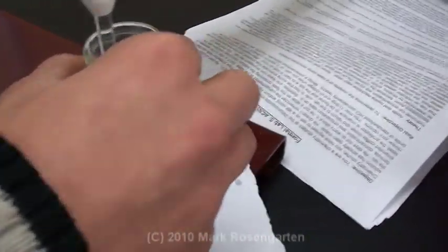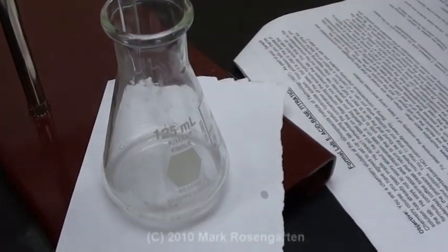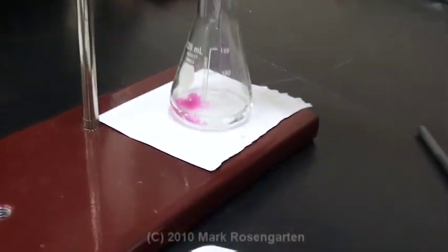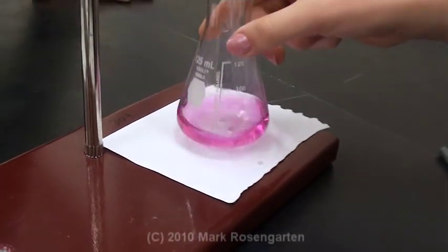Wait, stir it. Now that you've got it cleared back up again, put it back underneath the base and just add less base. Perfect. That was one drop.